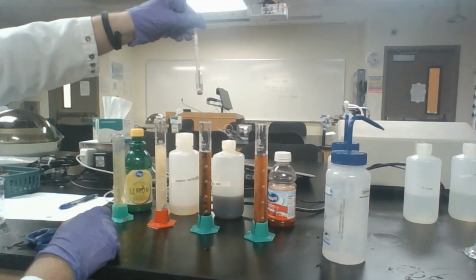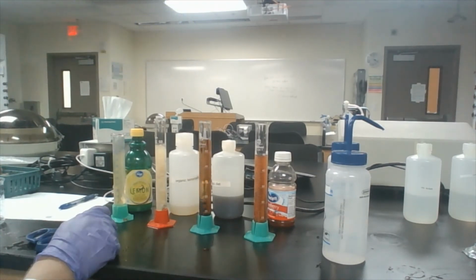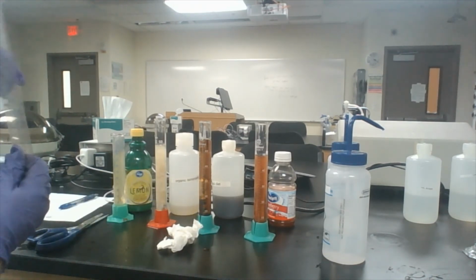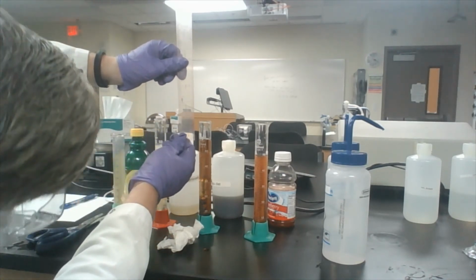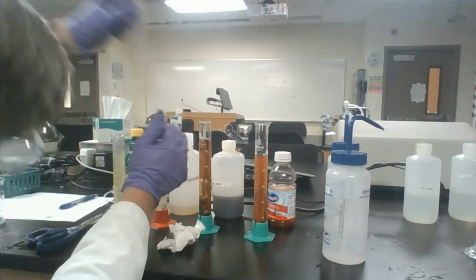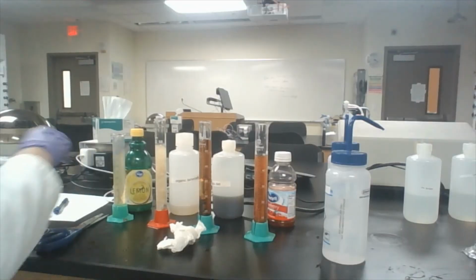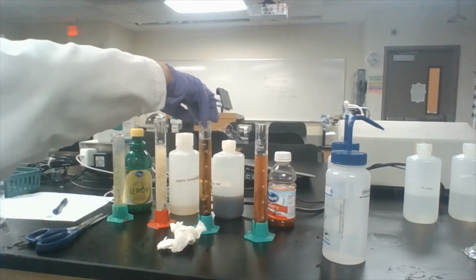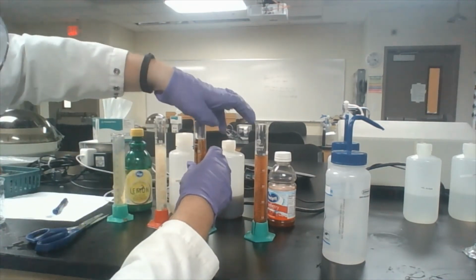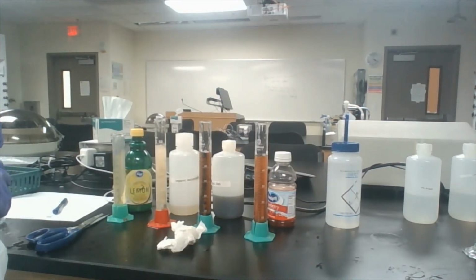Okay, so now we're ready to put it into our Diet Pepsi. Now remember, diet means sugar-free, or well, calorie-free, not sugar-free, as you can see. There's at least something sort of sugary dissolved in there, and that's comparable with our 0% sugar. So there's something in there causing buoyancy, but it is not sugar. Okay. So our hydrometer did show that Diet Pepsi has no sugar.